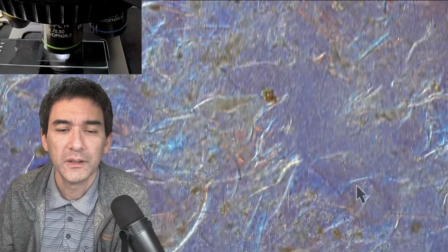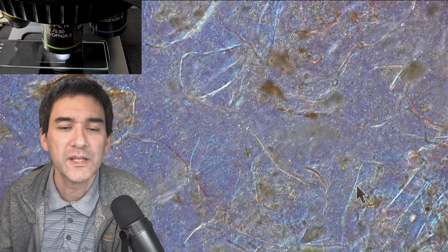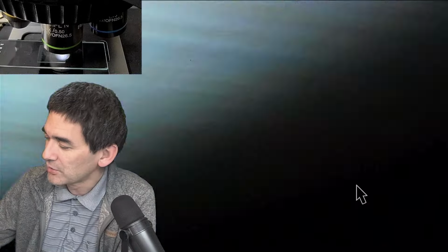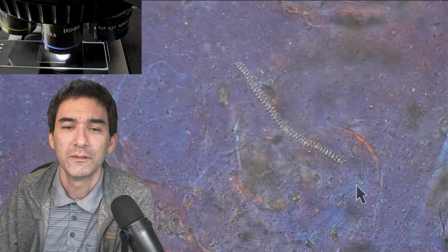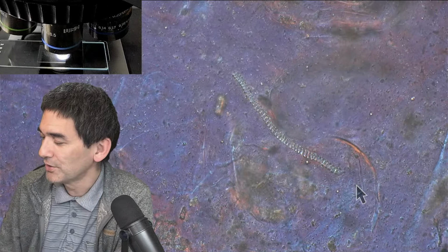Yeah. So, but yeah, good news. I did not see any microplastics, at least not to my knowledge. So let's go up here a little bit. Here we go. That's what I wanted to look for, and that's what I found. And now I can basically say we've now also seen this.